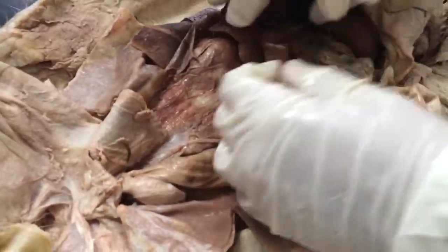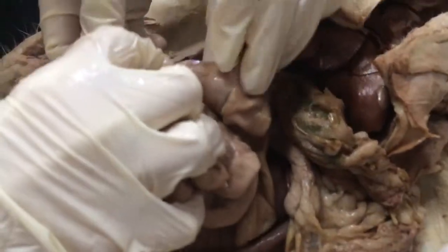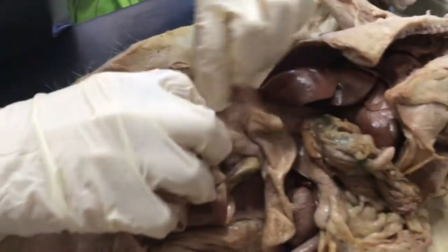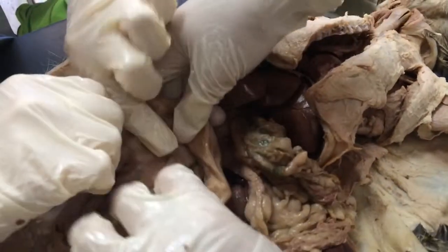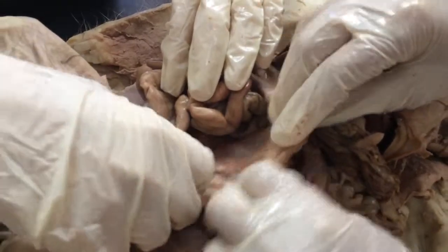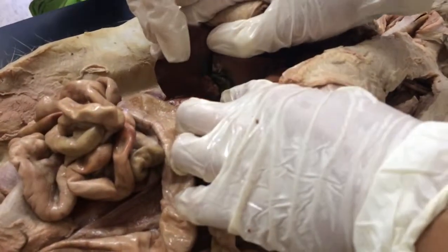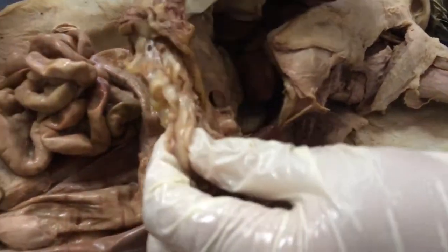Then the small intestines meets the large intestines at the cecum, which is right here. So this would make the small intestines. This would be the ileum part of the small intestines. Then we have the ascending colon, the transverse colon, the descending colon, and then the sigmoid colon, which feeds into the rectum, which is down here. And then up here we have the liver, and then inside we have the gallbladder. And then underneath the stomach, we have the pancreas, and that is the digestive system.